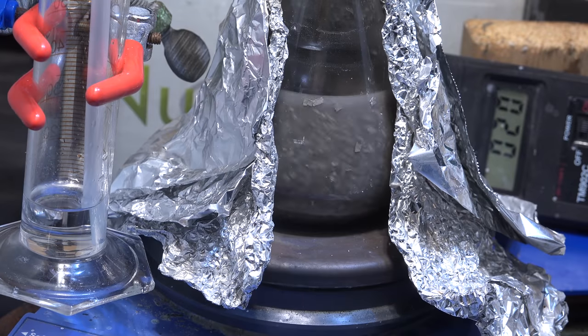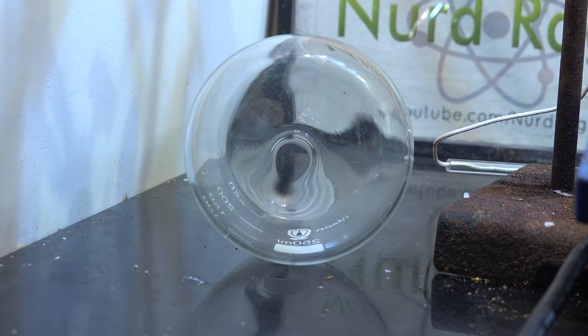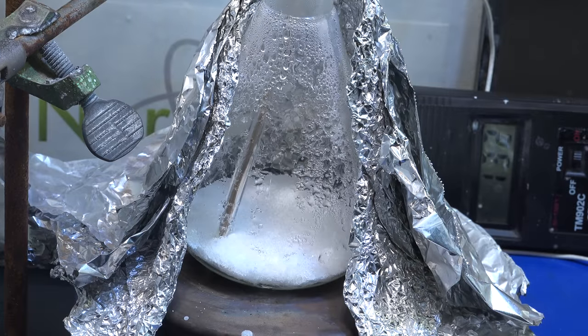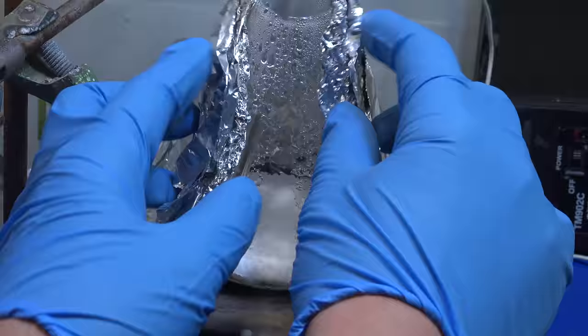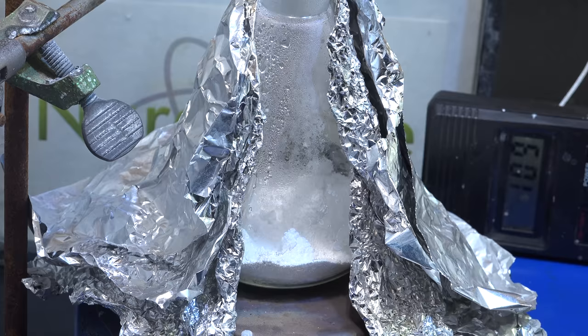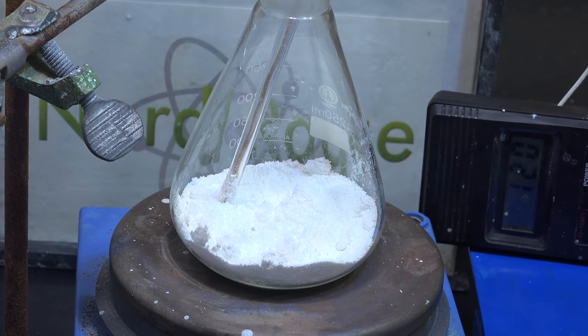Another thing I've been doing is trying to make lithium metal similar to how I make sodium metal. So I documented the flask appearance, as I wanted to test how corrosive lithium hydroxide was, and proceeded to dry my lithium hydroxide by directly heating it on the hot plate. Interestingly enough, it easily dries just by heating, unlike sodium and potassium hydroxides. And it doesn't damage the glassware either while doing so.